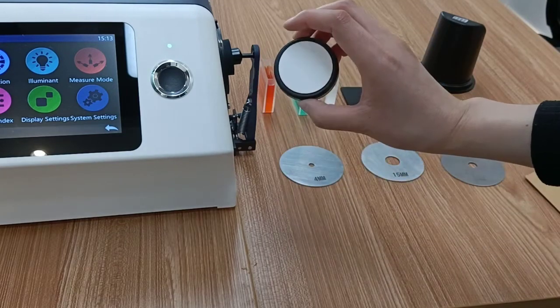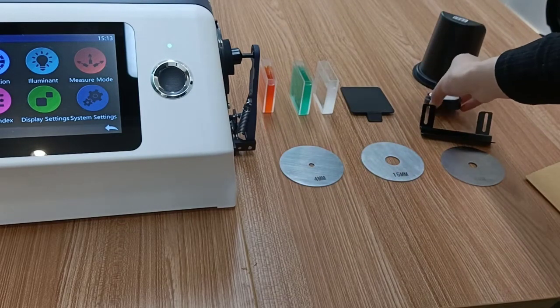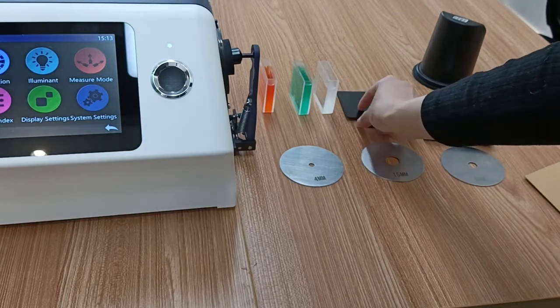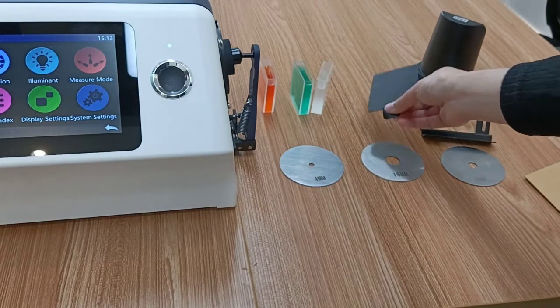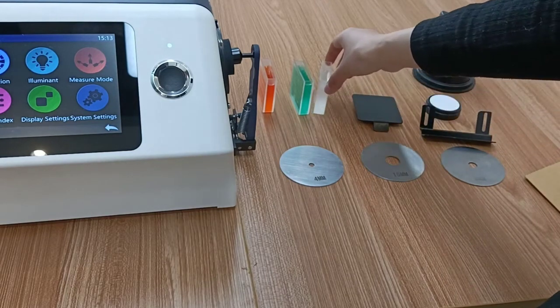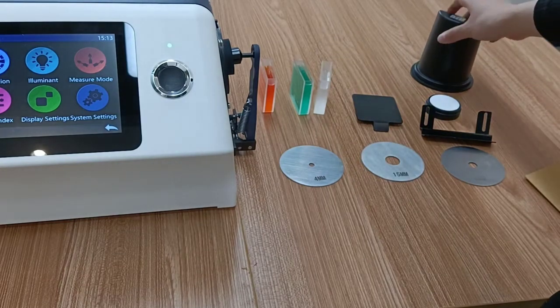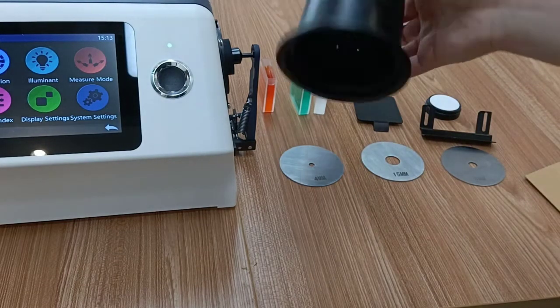Here are the accessories: the reflective white board, the transmissive black plate, and this one is the reflective black trap.